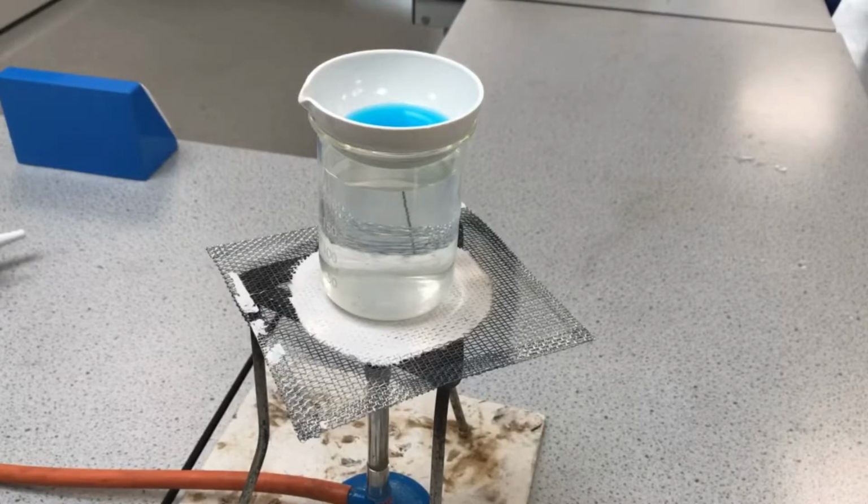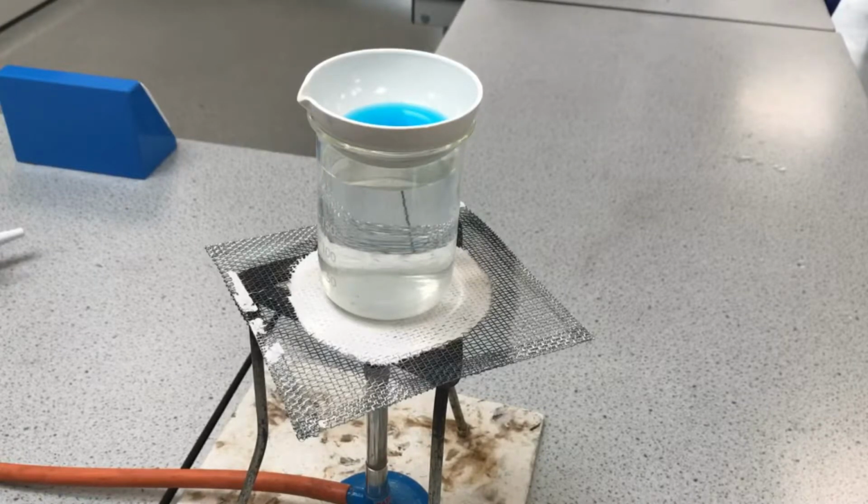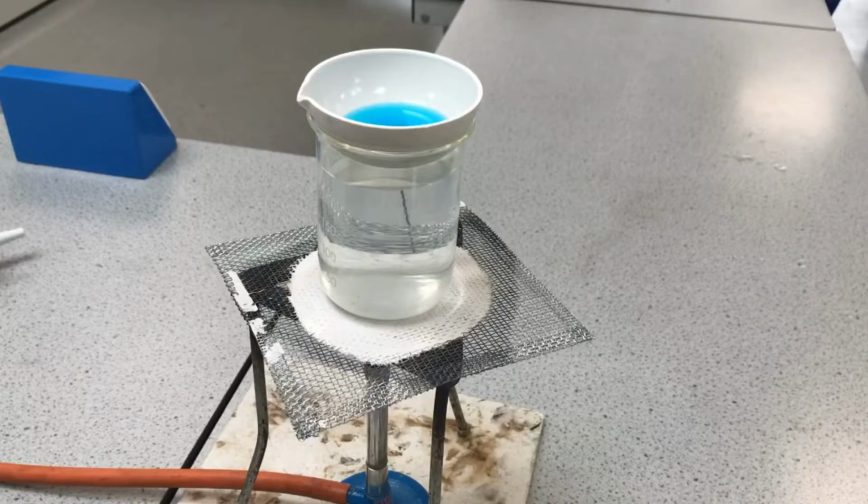The water's going to evaporate from here. So I just thought I could show you this because it's really useful for the required practical to know how you can get those copper sulfate crystals. We could just wait and get them with a bit of patience, but this is quite a good way of getting those crystals. For the required practical element of this at GCSE, you would need to write a method, probably a 6-mark question, a method explaining the stages that you would go through to get from your sulfuric acid and your copper oxide to getting your pure copper sulfate crystals.